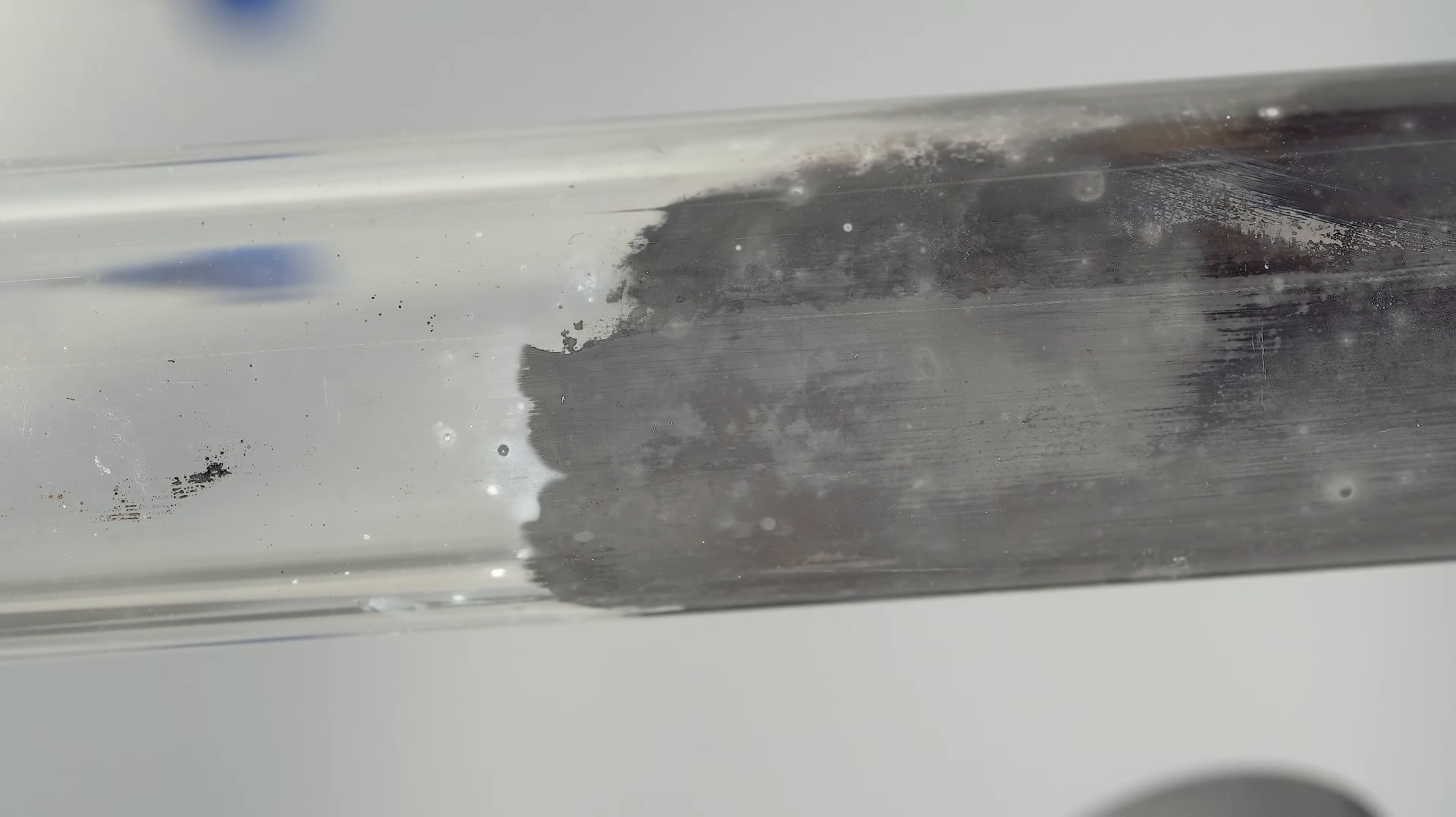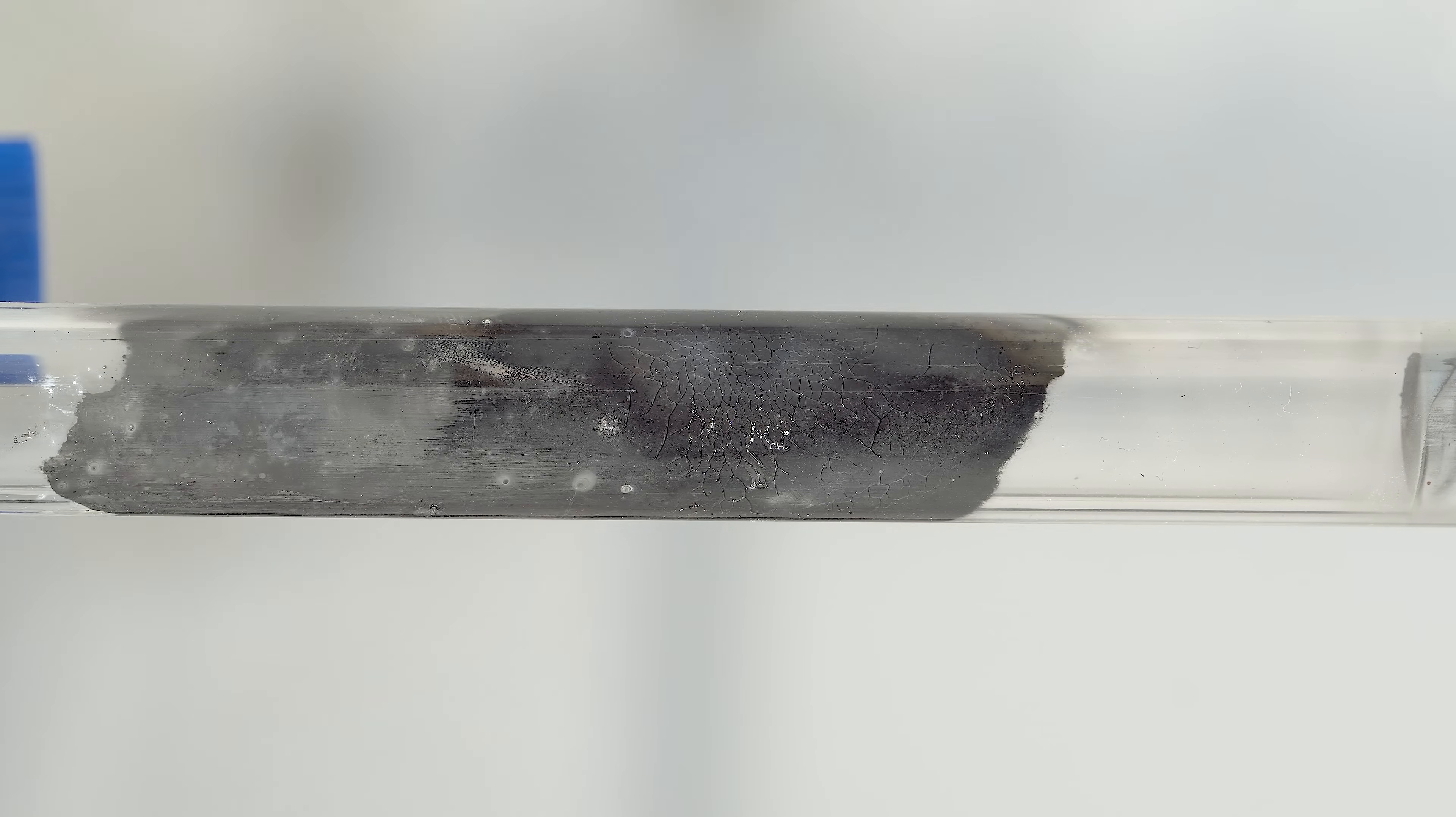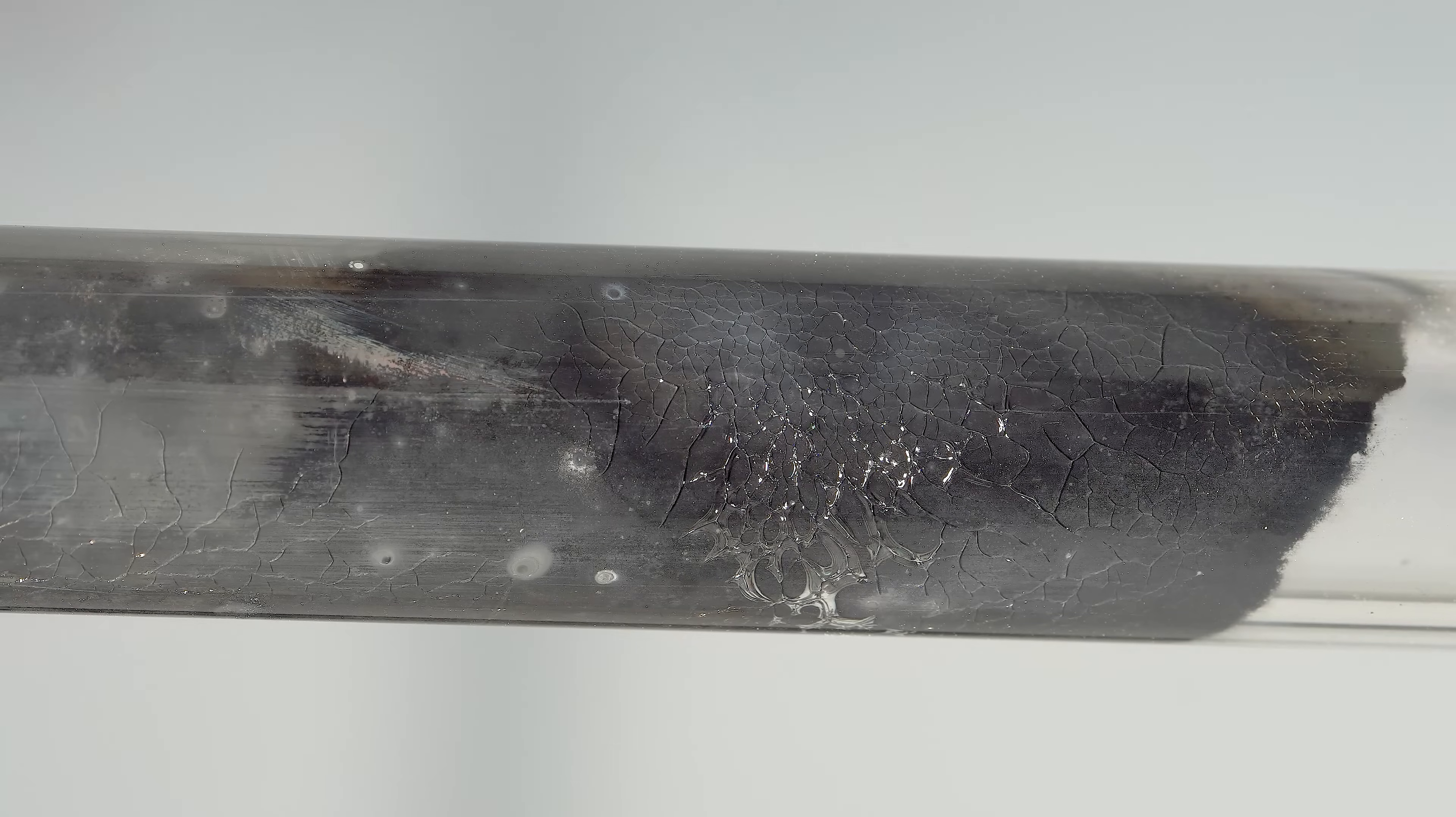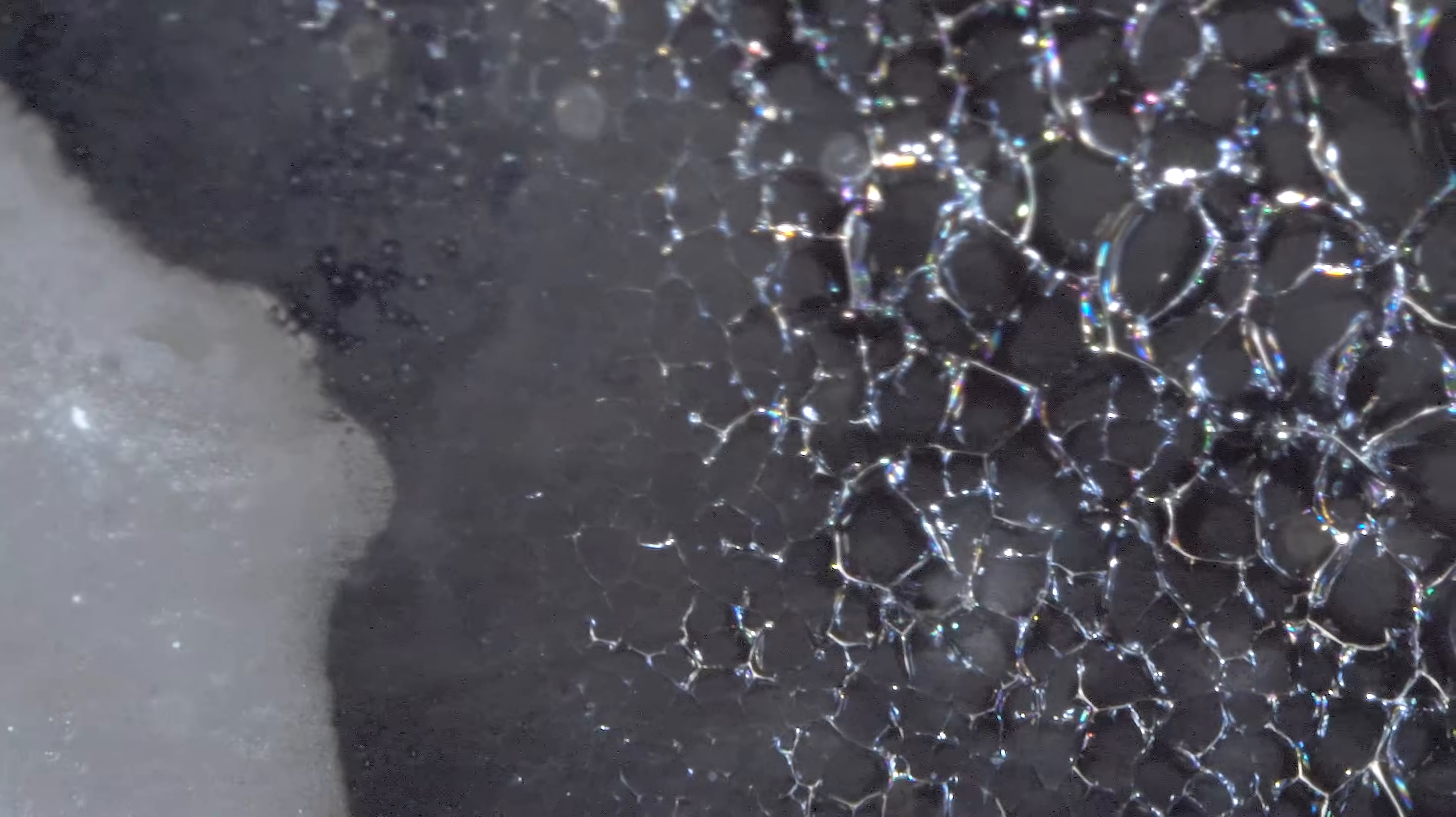The appearance of these cracks you see here is influenced by various factors, including temperature, hydrogen dryness, the concentration of hydrogen fluoride forming during the reaction, and others. Look at these cracks on ultra-macro frames.